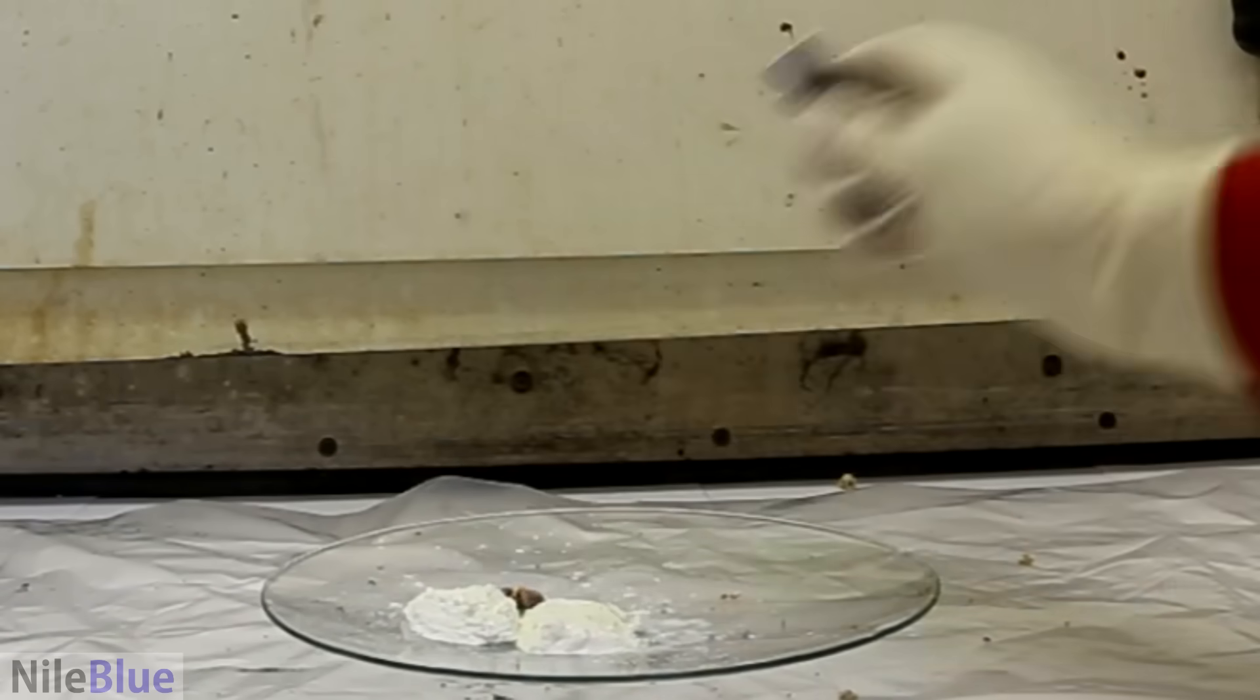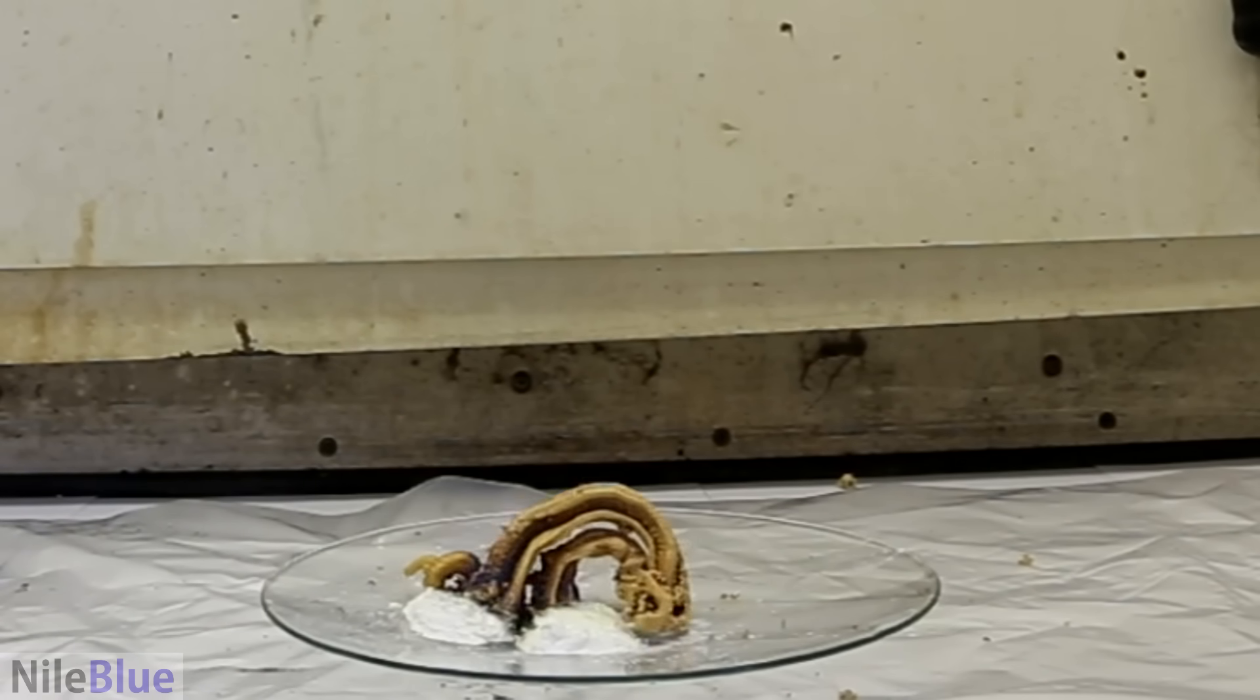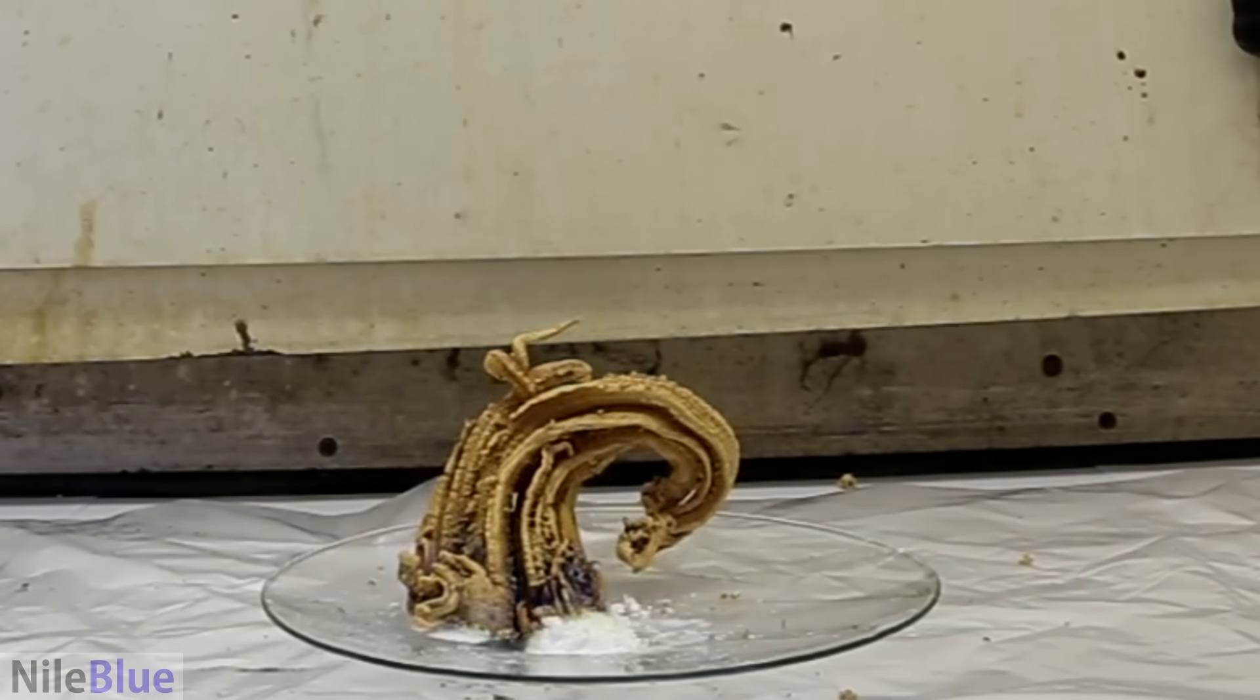One of the first videos that I ever made was the pharaoh serpent, which was a mercury-based compound that when you burnt it, it grew this weird, almost alien-like snake thing.